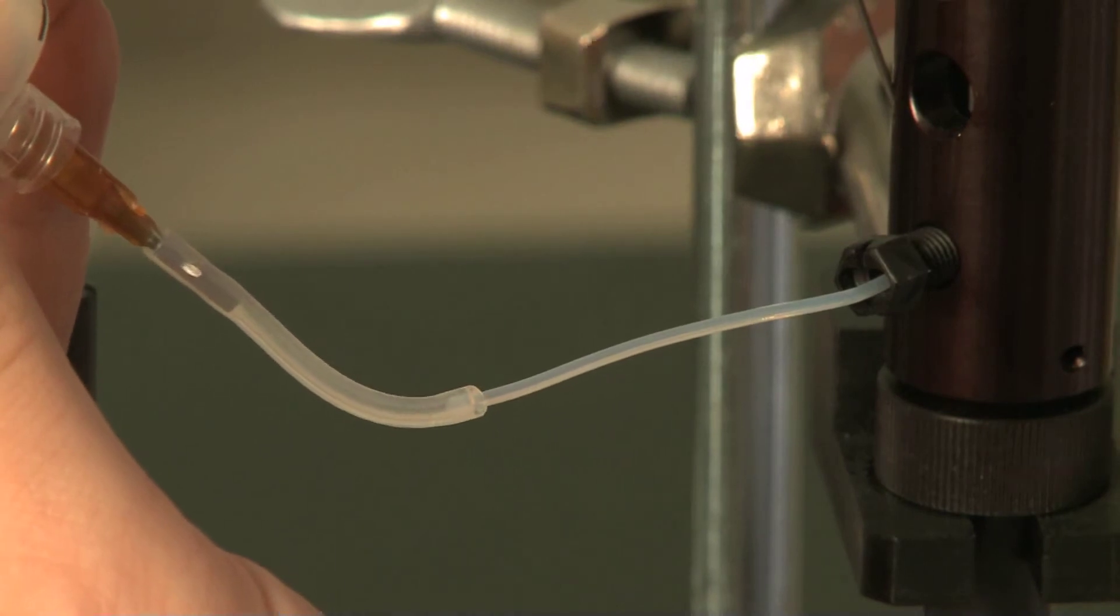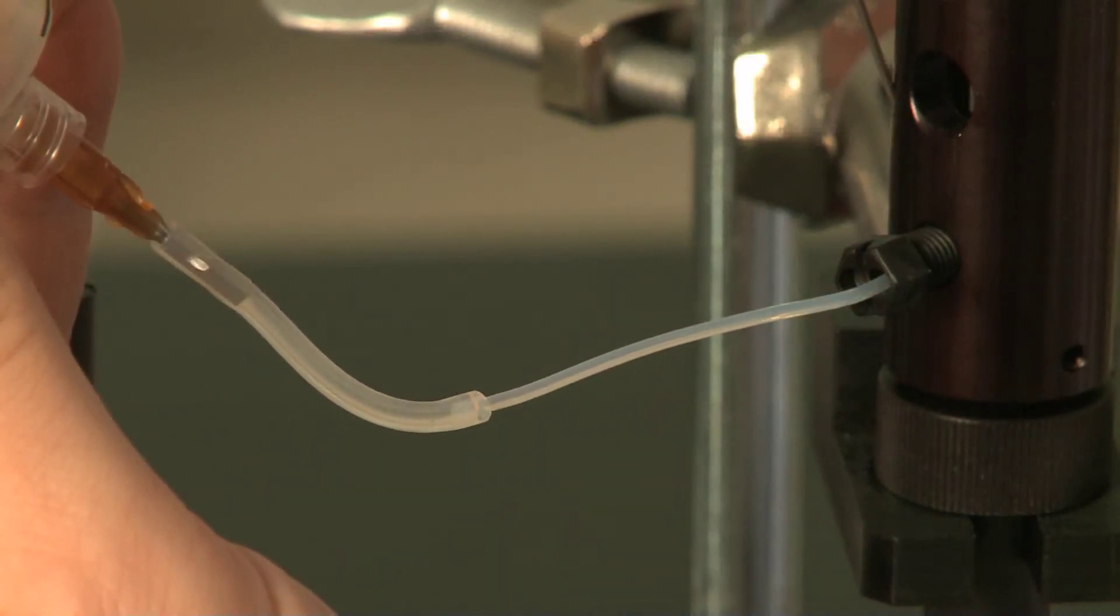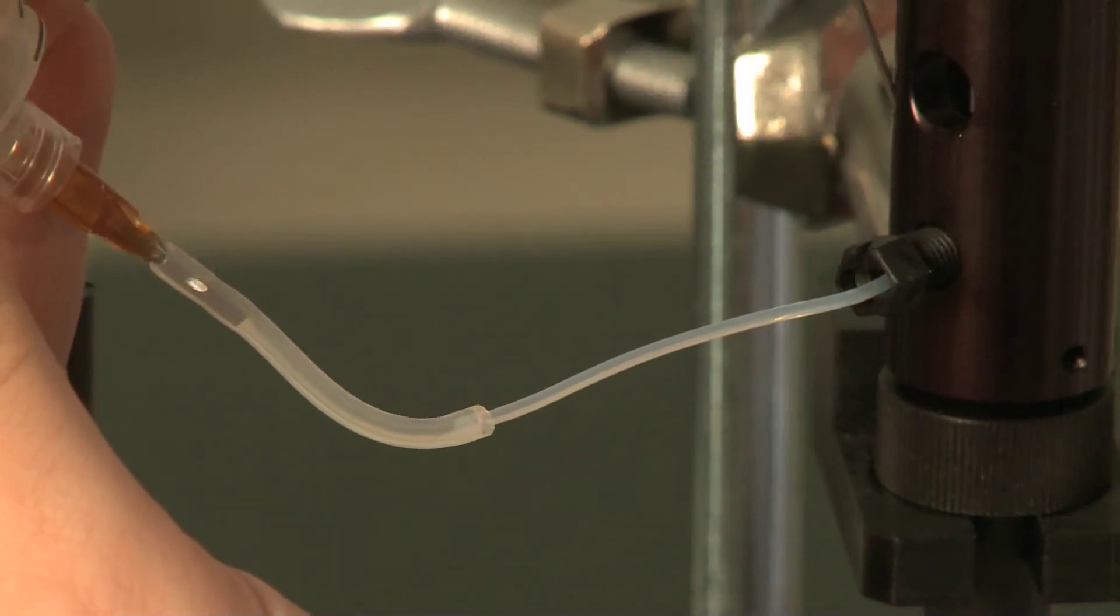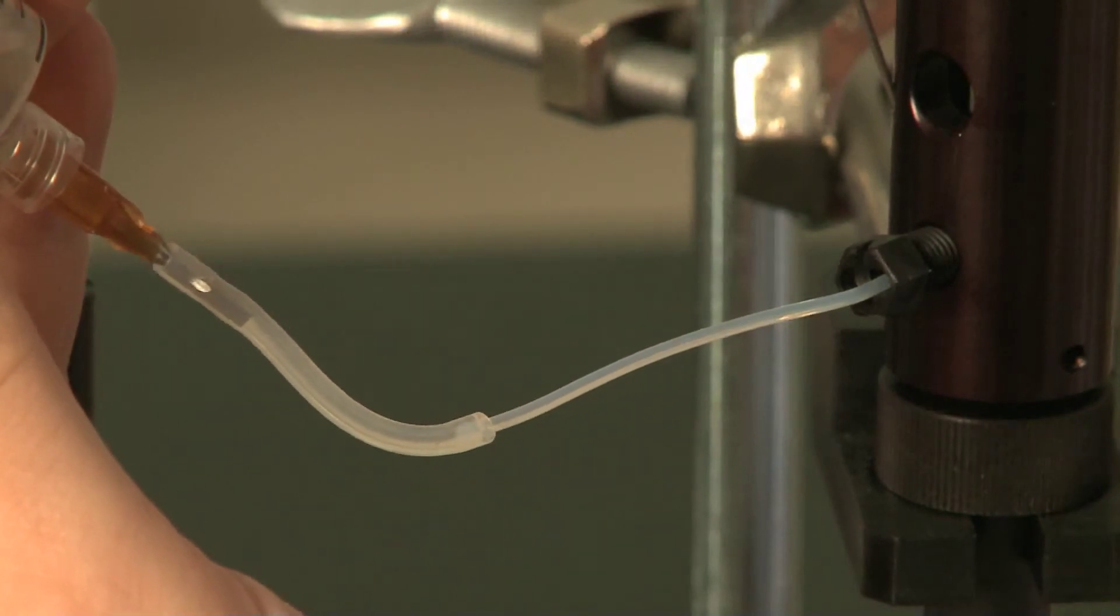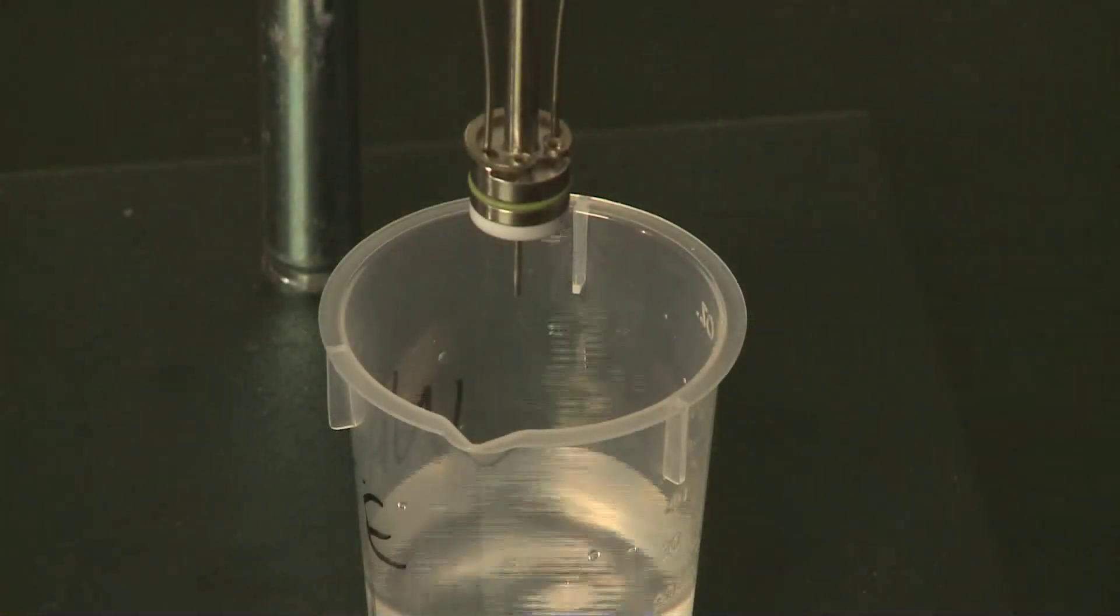We just connect this little piece of tubing here and inject the water through. You see how it comes out the bottom there. We'll just inject that straight through.